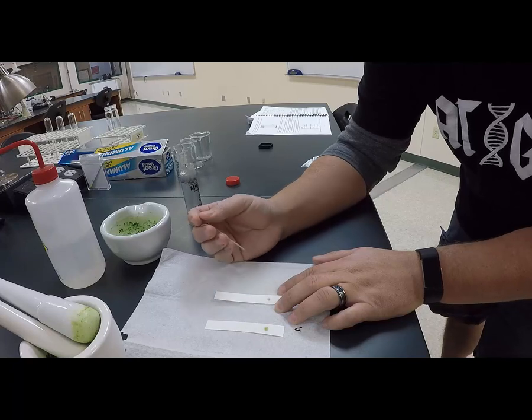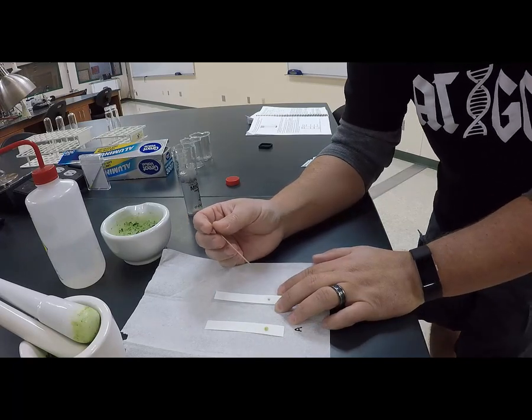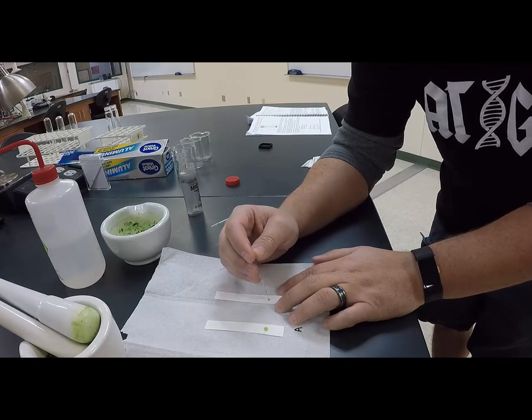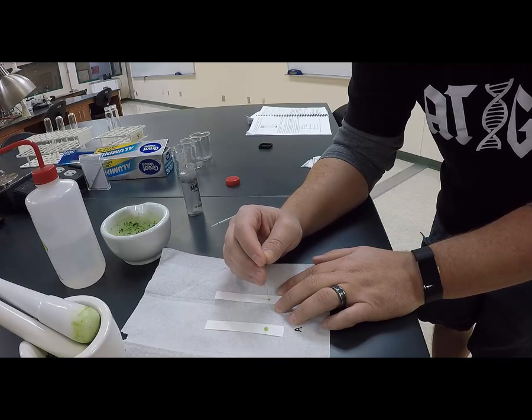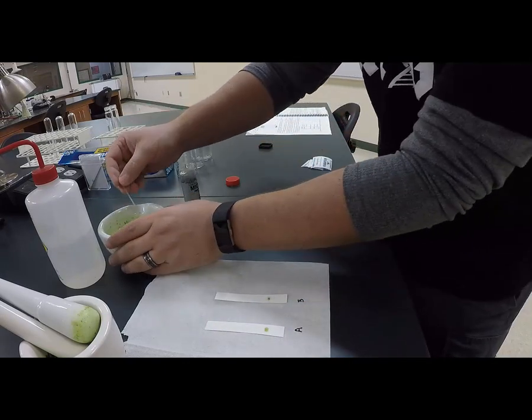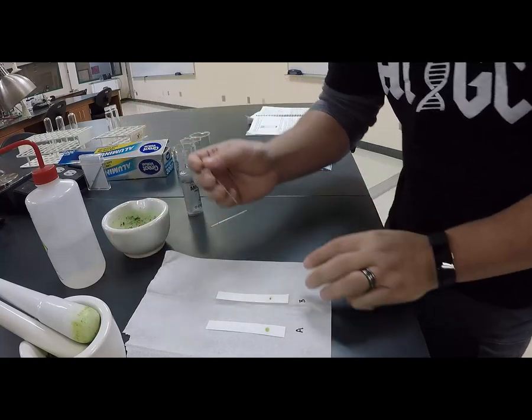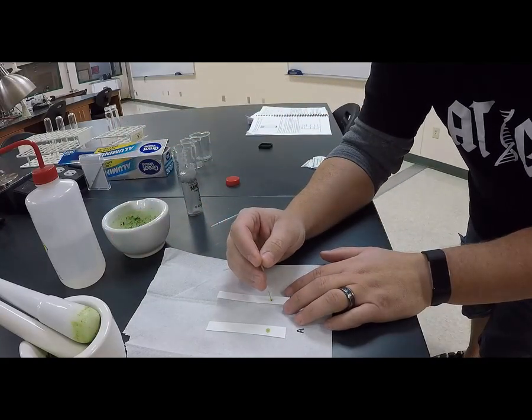And once it's saturated, you're going to have to let it dry for a little bit. Acetone dries really fast, so you just let it dry and then keep applying dots to that center line. And the idea is that you're laying down these pigment molecules, and we're going to run them through chromatography paper, which will separate them based on size and how far they're going to travel through the solution.